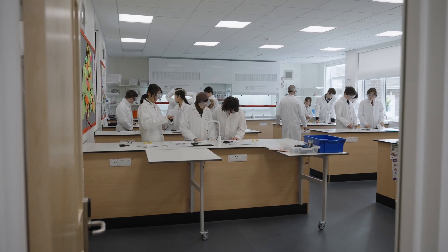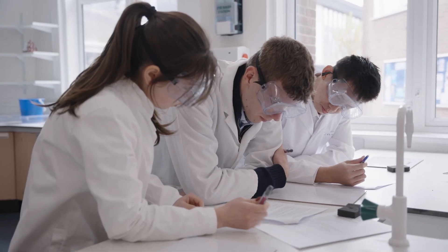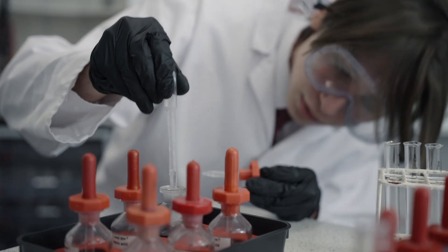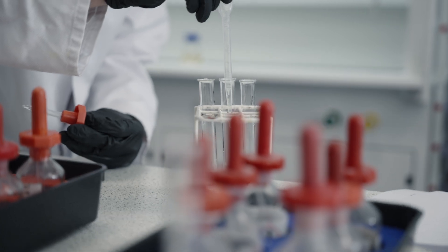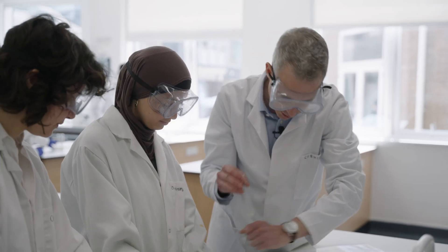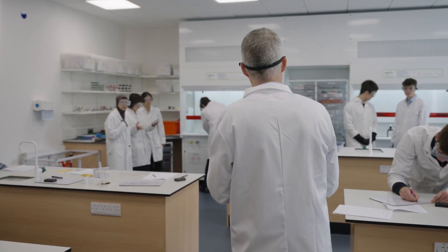The chemistry department has got seven wonderful labs that we can do the practical work in. The students have been working in small groups today, which is great because we've got a huge amount of space here. The facilities that the lab provides means that all the students can get first-hand experience of the chemicals and the procedures, and it also means that I've been able to go around and speak to the students individually and make sure they all understand the chemistry that's behind the observations they're making.